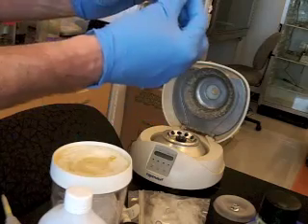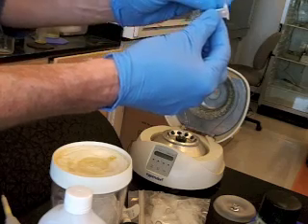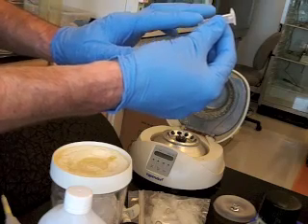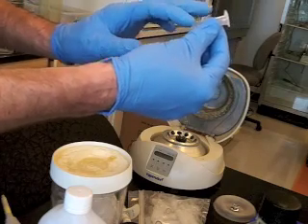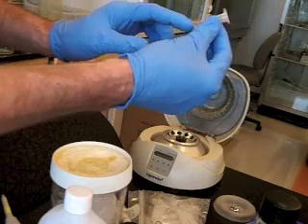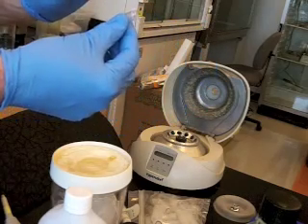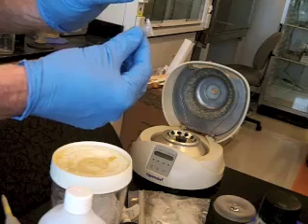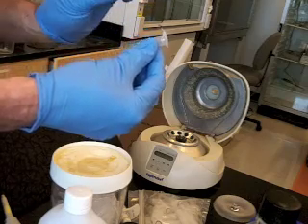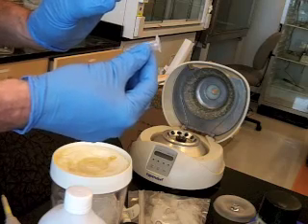So tubes spin like this, and instead of spinning stuff down to the bottom of the tube, if there's material that's going to spin down, it will make sort of a comet tail shaped mark along the outer edge and bottom of the tube. Lots of times that material is stuff that we don't want to touch. Sometimes it's debris that we don't want to touch. Sometimes it's our product that we don't want to touch.